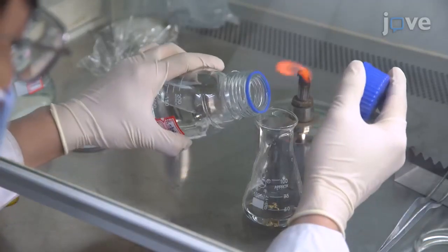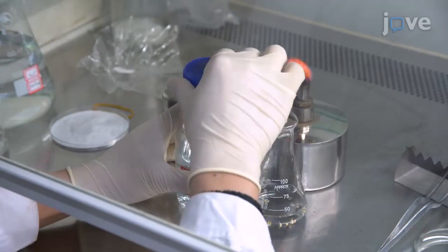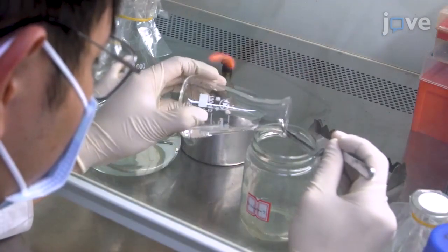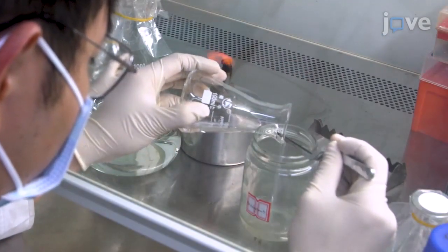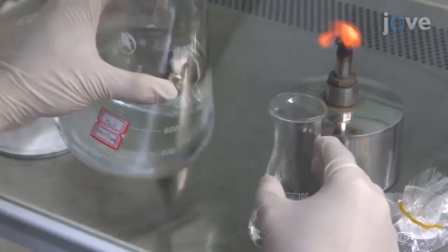At the end of the sterilization, replace the ethanol with 5% sodium hypochlorite. After 15 minutes, decant the sodium hypochlorite and wash the seeds with sterile deionized water five times.